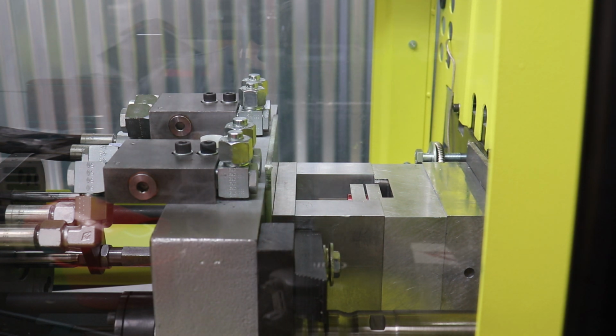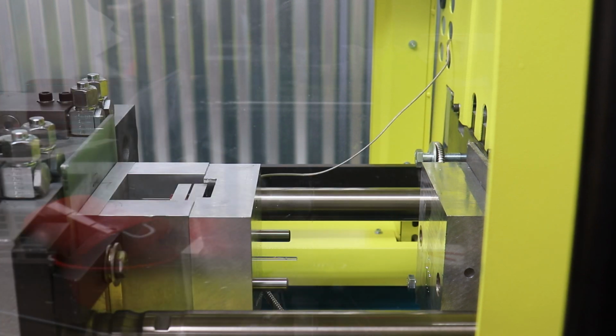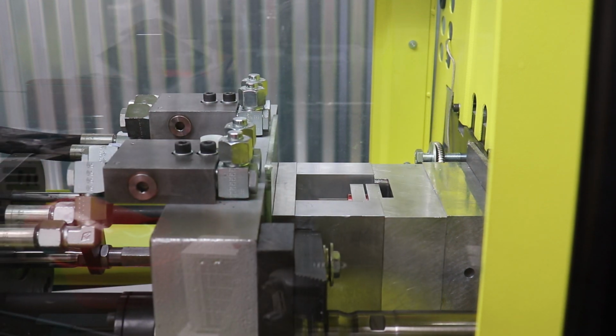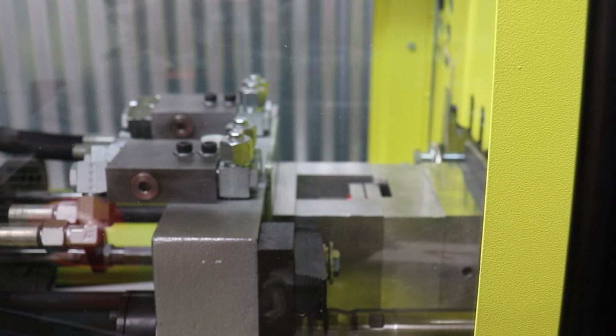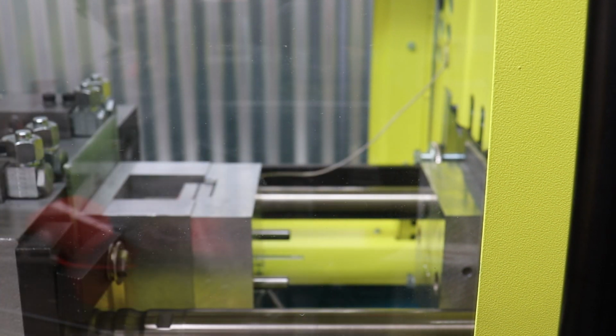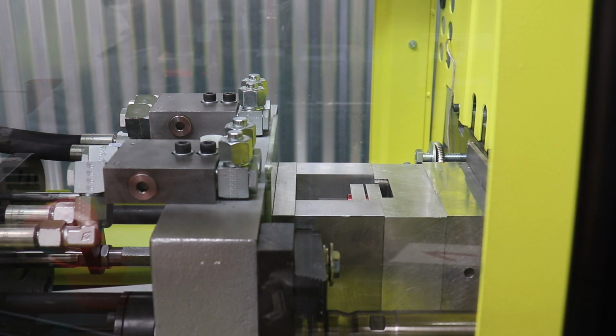Because the molding machine is pretty accurate on sensing obstacles, but it can't really react to a 100 micron filament of plastic. So I'm going to be ready on the stop button if I see that one of these parts is hung up on the little filament string that's drawn out. I'll show you one of the parts coming out in a second, but we want to get the process dialed in and happy before we start looking at parts. Because if we've done any damage, the damage is done.